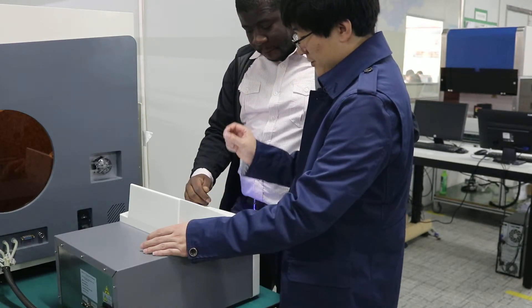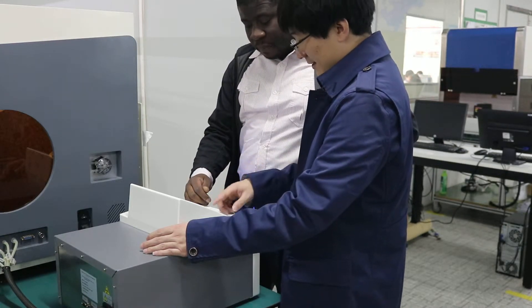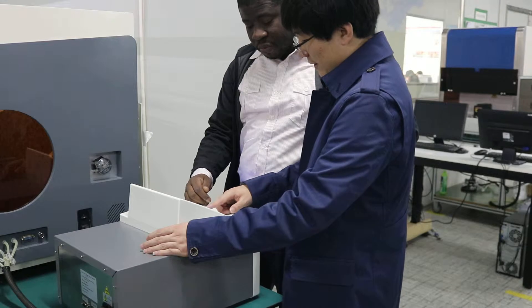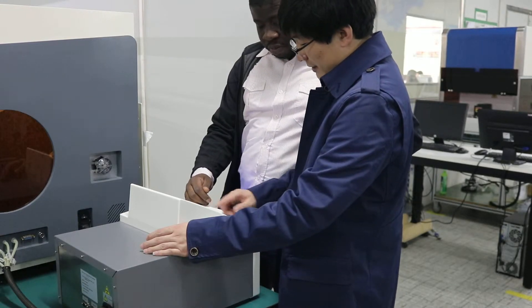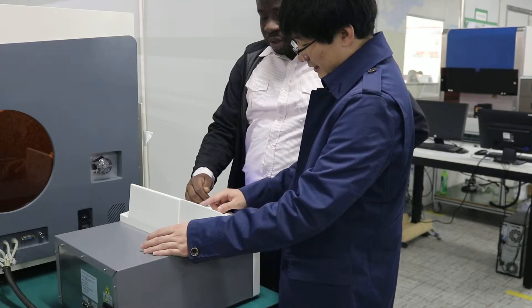This one, for example, is the same. This one is the cut-off. Cut-off means the same.